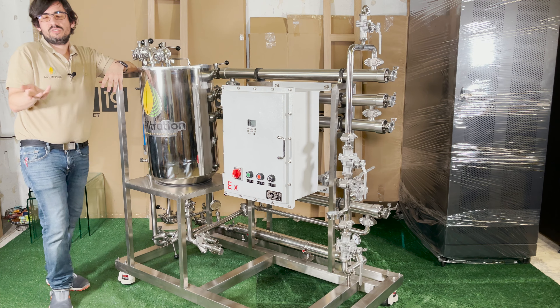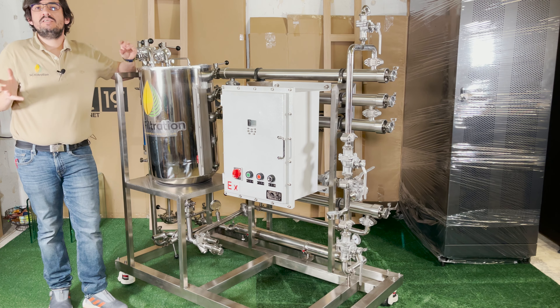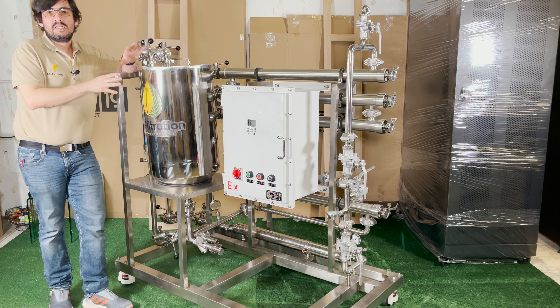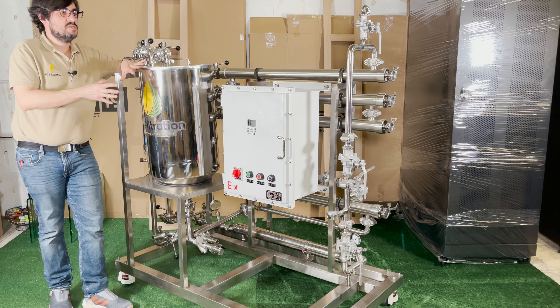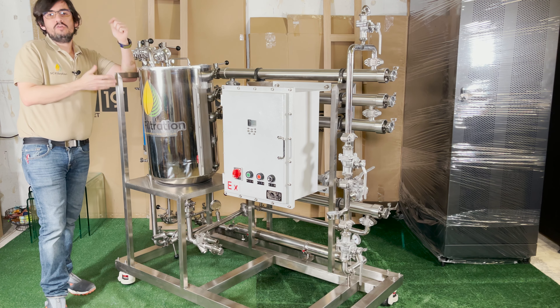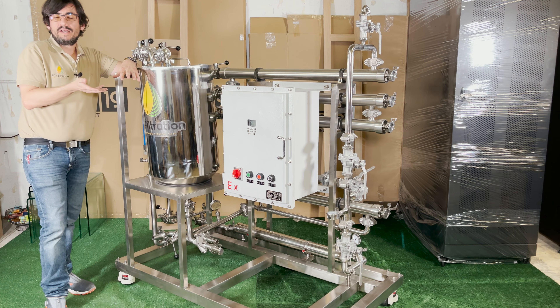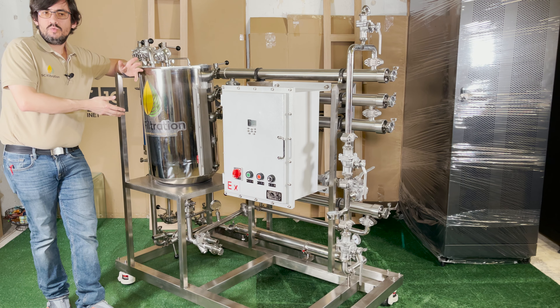The warmer that we filter at — and I'm not saying hot, but the warmer we filter at — the faster it's going to flow. If we tried to filter at minus 20 Celsius, the system is not rated for those temperatures, and it wouldn't work well anyway because it would be so viscous it would flow very slowly. As the solvent circulates, the pumps generate a little bit of heat, so the temperature will gradually increase. For solvent recovery, higher temperatures means it flows faster.